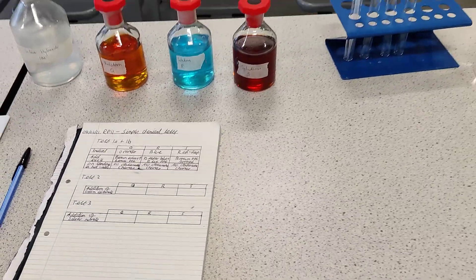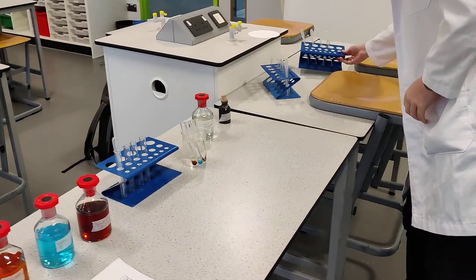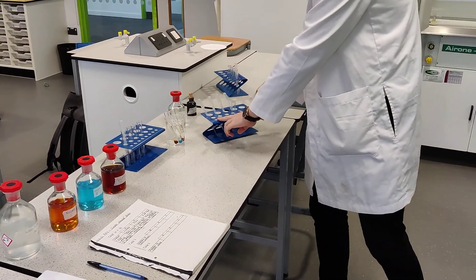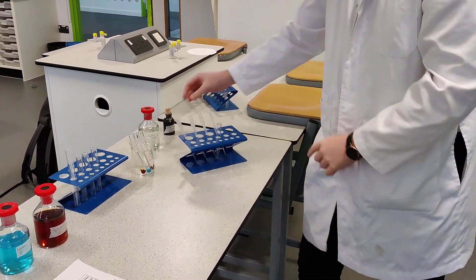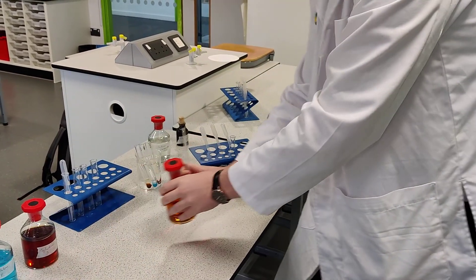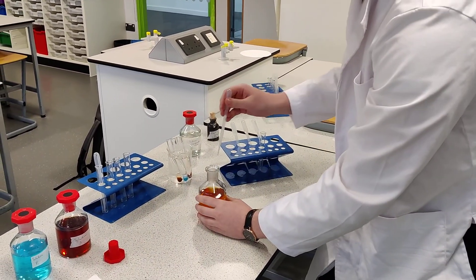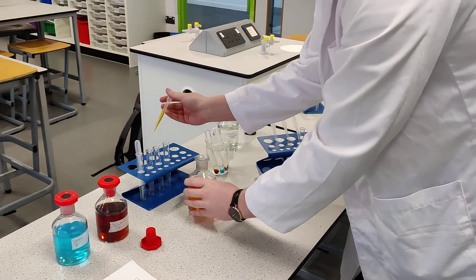What is our next step then? So now we're going to move on to step two. We're going to get our pipettes that we used before — so we're using the same pipettes — we're going to have Q, R, and S. I'm going to fill up some samples in test tubes, like before. So we're now moving on to a new, fresh test.